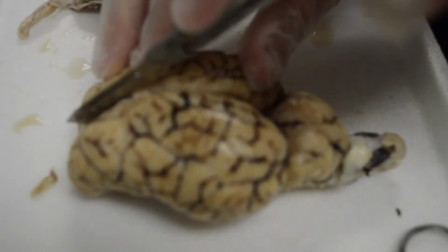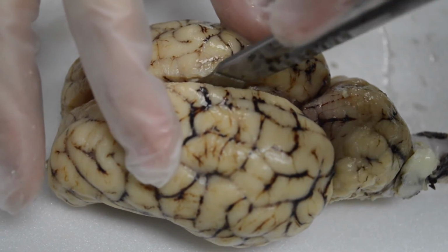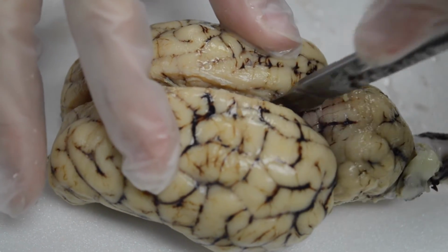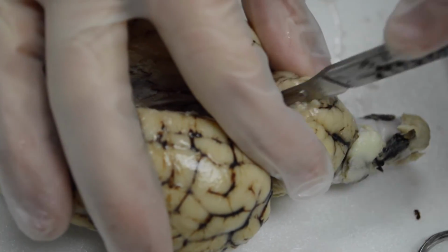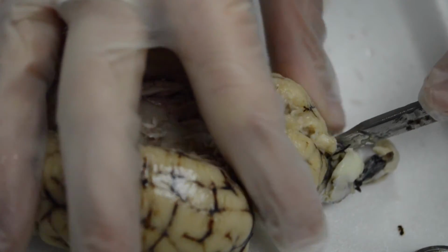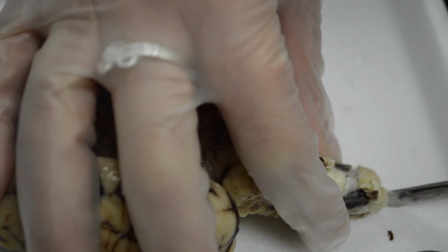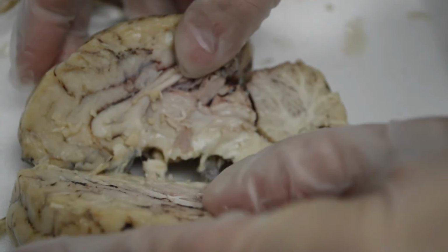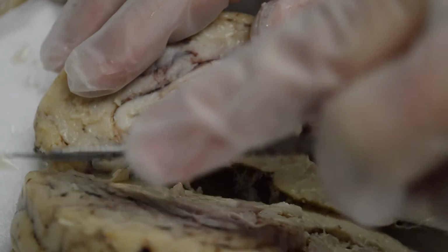Okay. I'm just going to follow the longitudinal fissure, which is there to separate the hemispheres, and we're going to make a mid-sagittal cut. This is a very pliable structure, so it's going to cut really easily right down through the middle. And I'm going to do the same thing, cut right down through the middle of the cerebellum, or close to the middle. Didn't do a great job there, but finish cutting there a little bit.